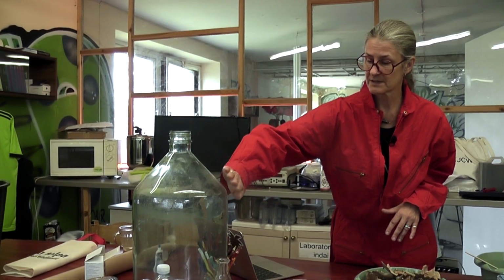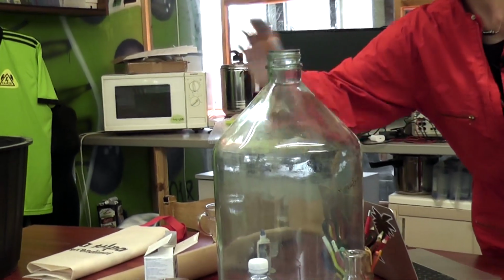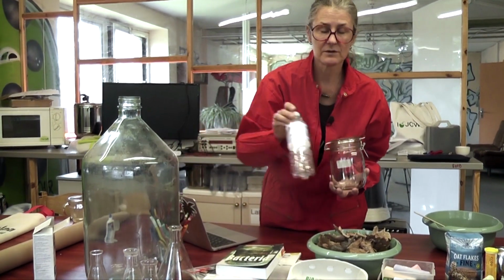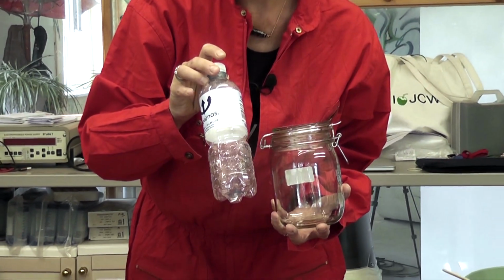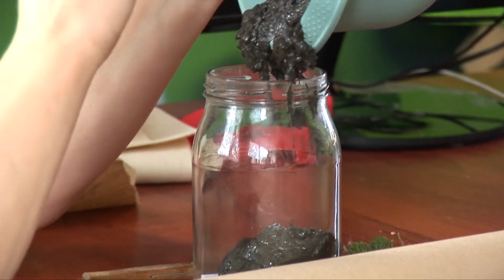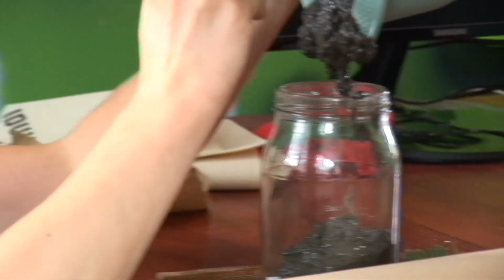So this step is to decant, but often we might want to use a smaller container. So we have this one. You could use something like this. You can even use a plastic bottle. What's important is for it to be see-through so that over the hopefully months and years of enjoying your Winogradsky column, you can see what's happening. I think that was step 3.